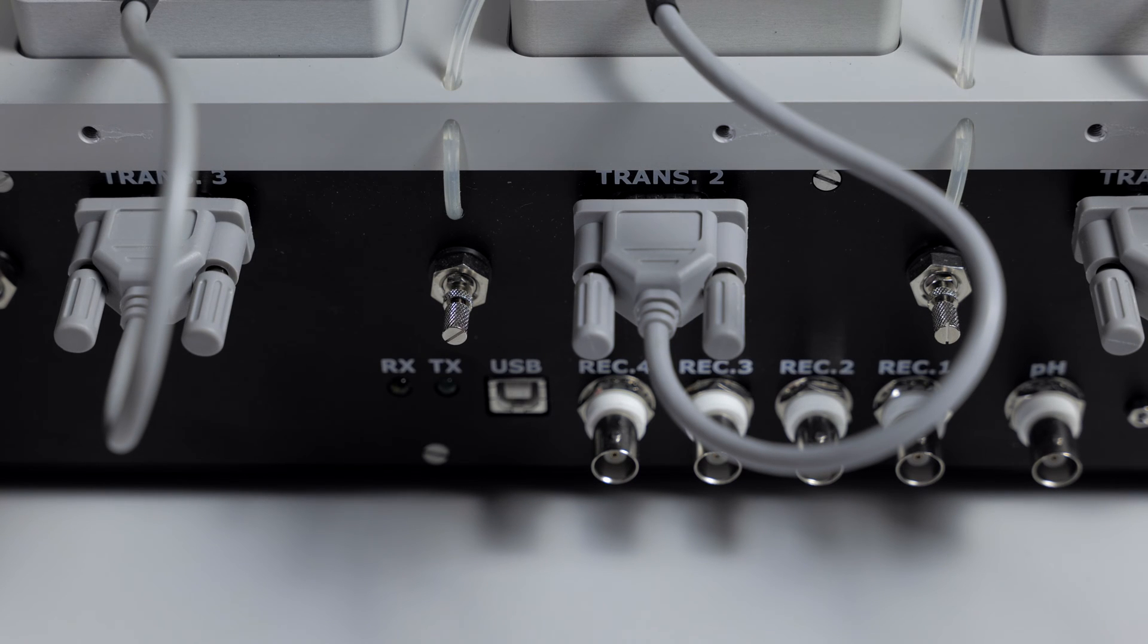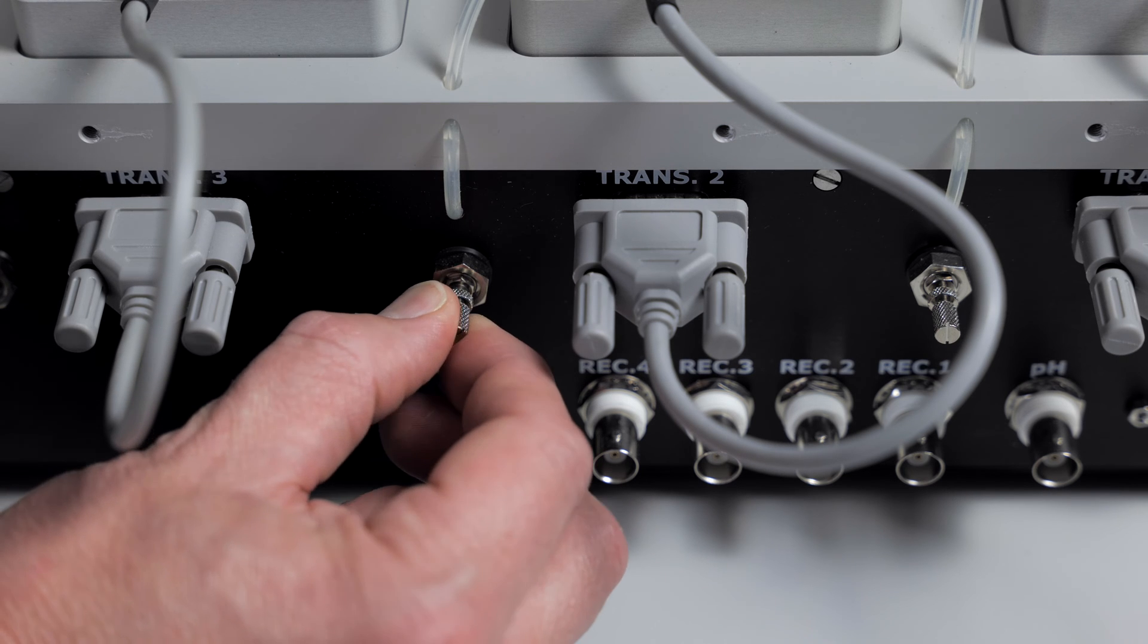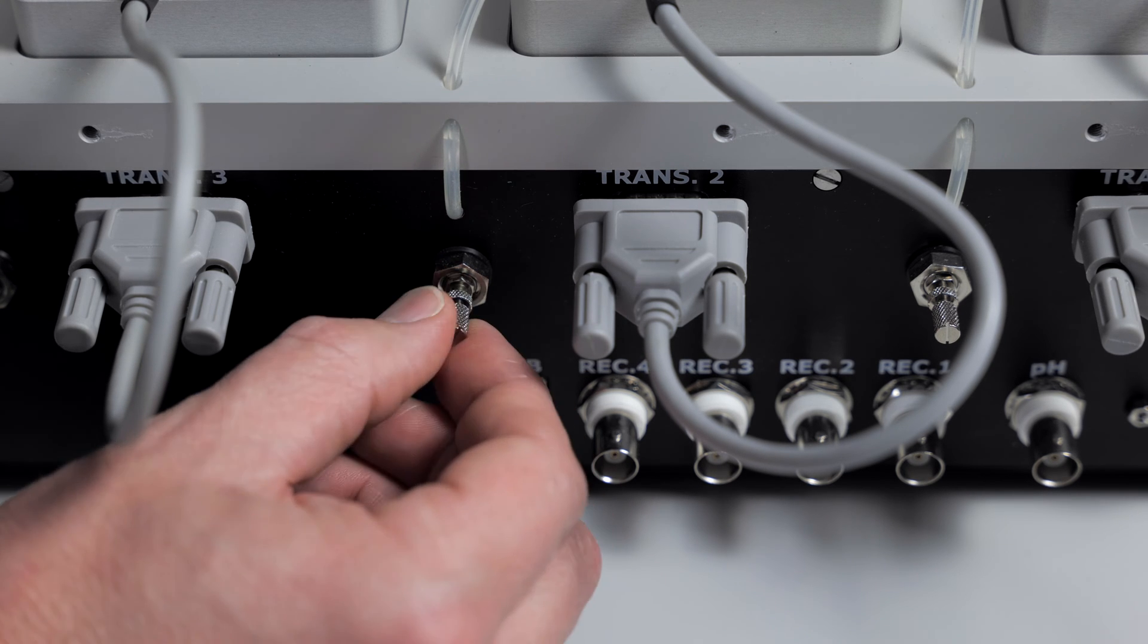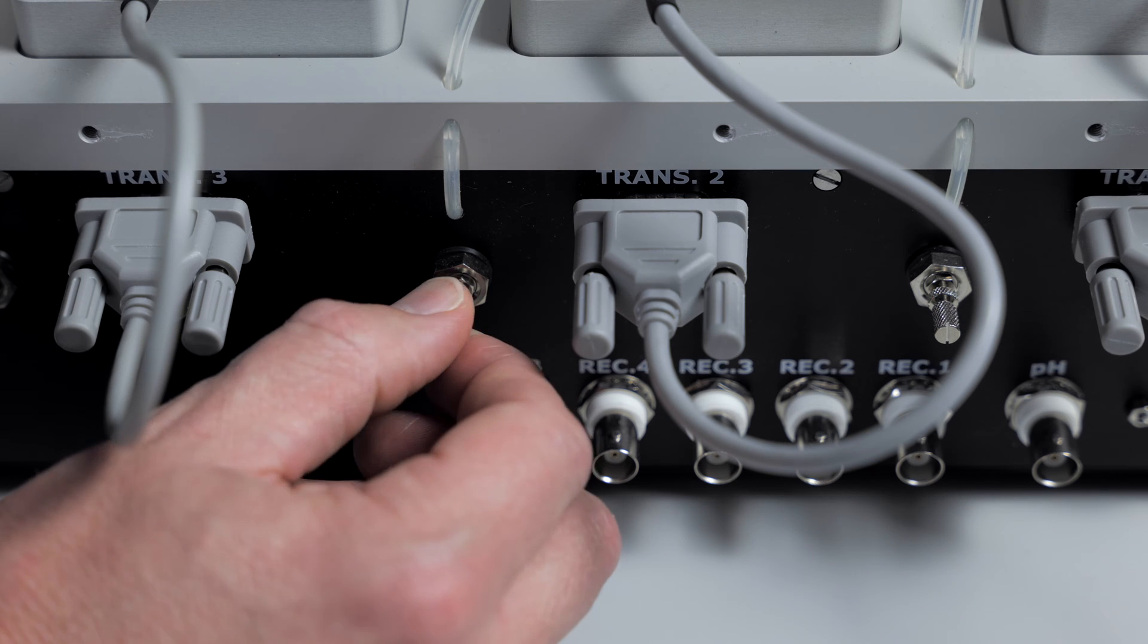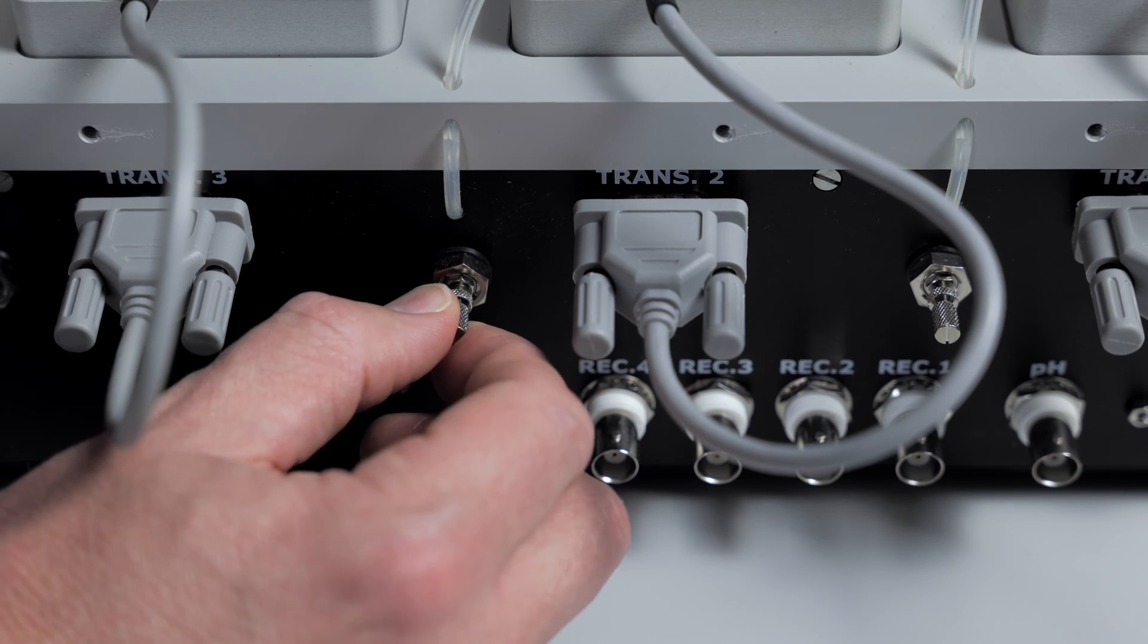The first step would be to check the needle valve on the back of the interface to make sure that it's open. You can twist it, make sure it's open, and see if that changes the bubbling.